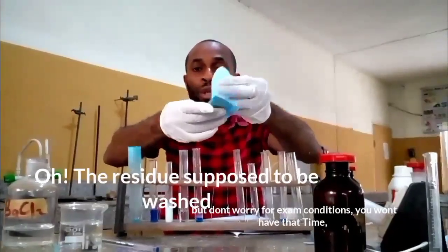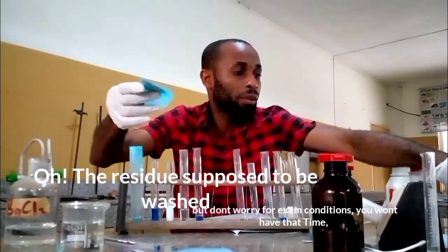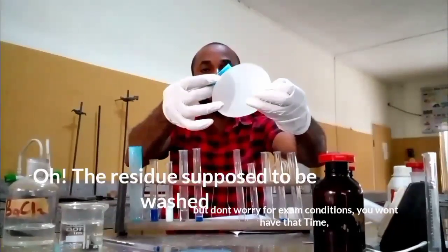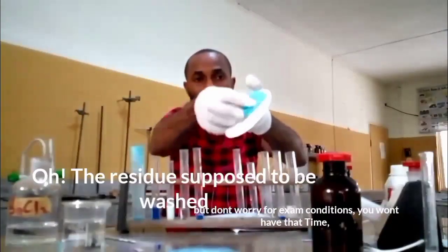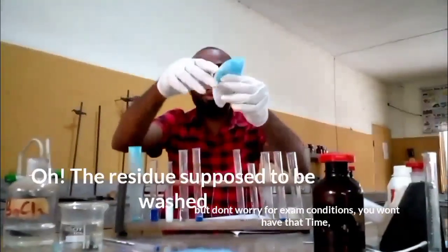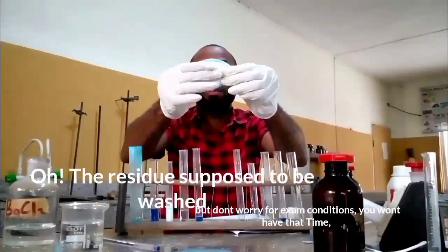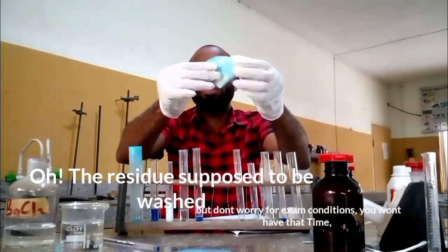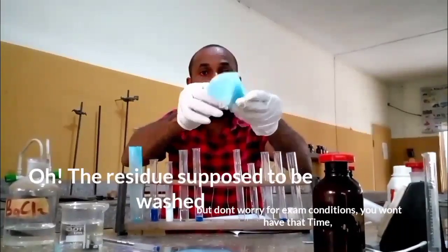If, for instance, your teacher gave you only one for this practical, I go for the second one. The second one, I'm using 90. I place it in this form, then still divide it into 2, and divide it again. What I'm trying to do is make sure that the residue gets a little bit dried. That's what I'm doing here.